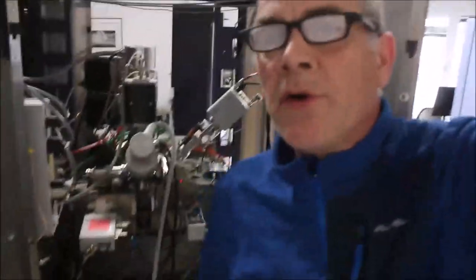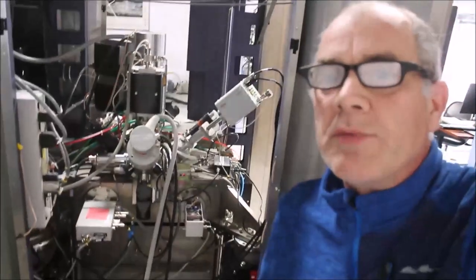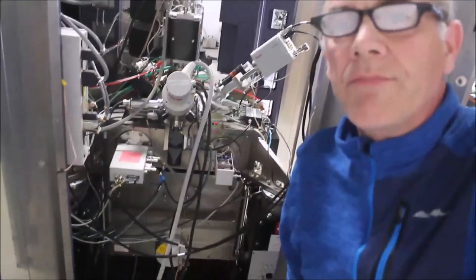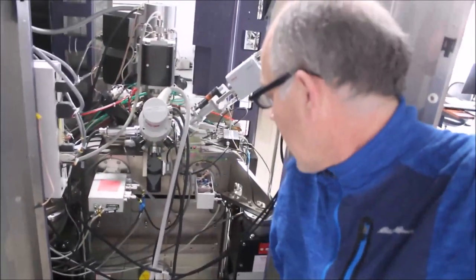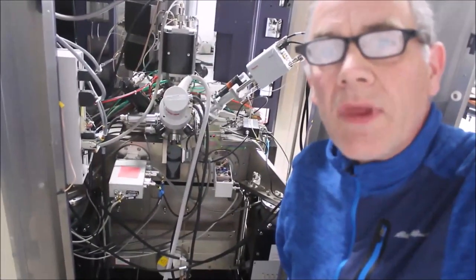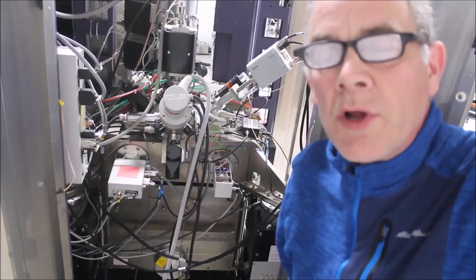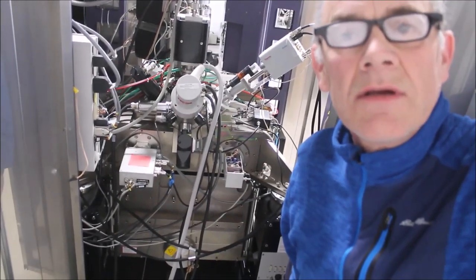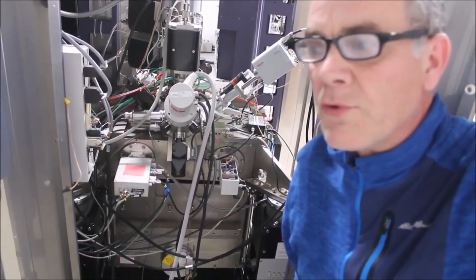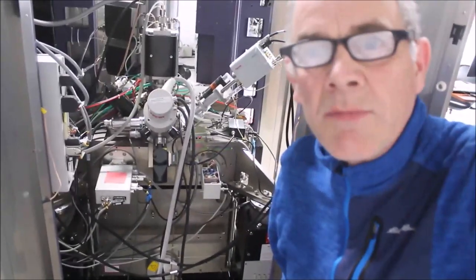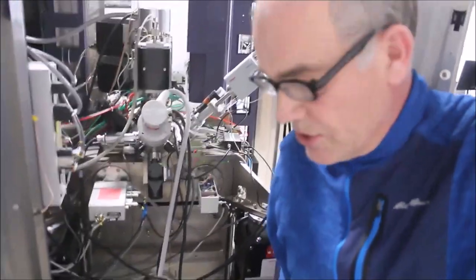Hello dual beam FIB users. We're here behind an XL835 dual beam system and I'm going to remove the sump so that we can access the stage and remove it and service a little problem we're having with the Z axis. Hopefully we'll be able to record this in a video that will be useful for somebody. Let's get started.